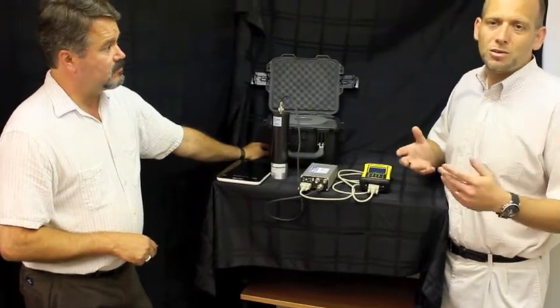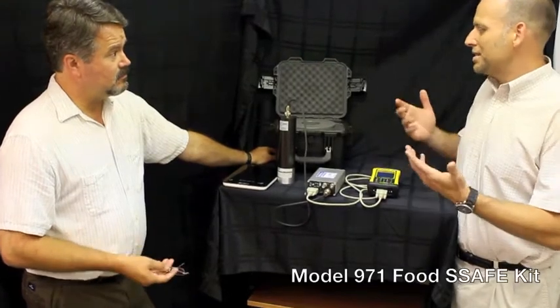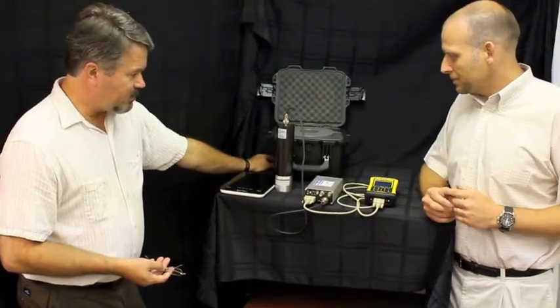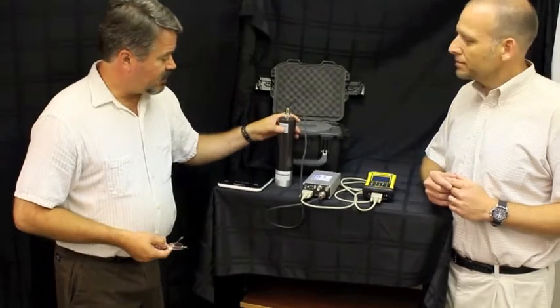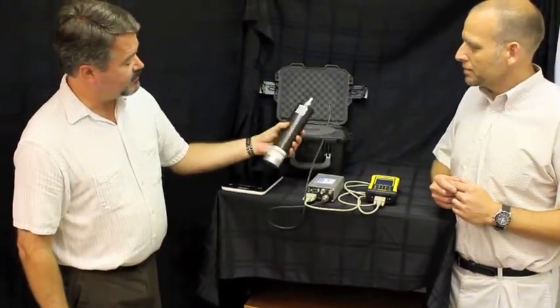Mark, how would you begin the preparation work after you've unloaded your Food Safe kit? Well, the main components that are of interest on the Food Safe kit is a two by two sodium iodide detector, that's a two inch by two inch sodium iodide scintillator crystal.